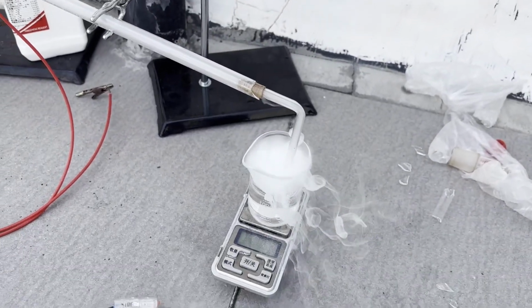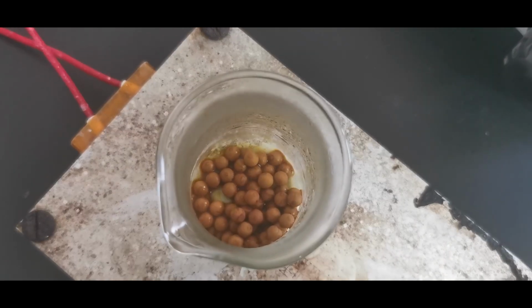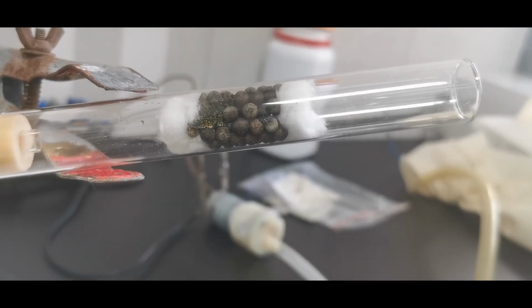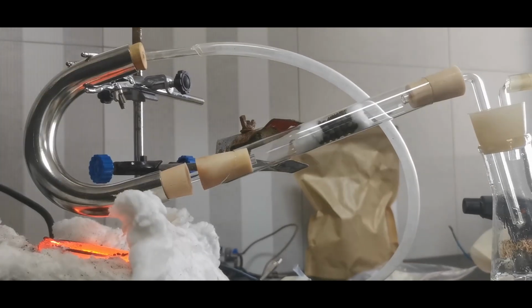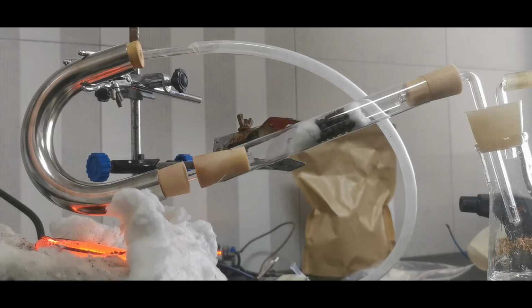So I basically tried a few designs and went through a decent number of failures. For example, here's me soaking molecular sieves in ammonium chromate solution and heating it up to obtain chromium oxide loaded on molecular sieves, which should have a larger surface area than chromium oxide alone. I tried passing sulfur dioxide from burning sulfur through the catalytic chamber, but nothing really happened.